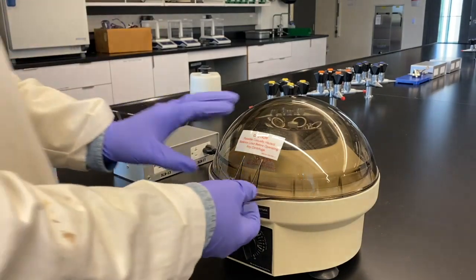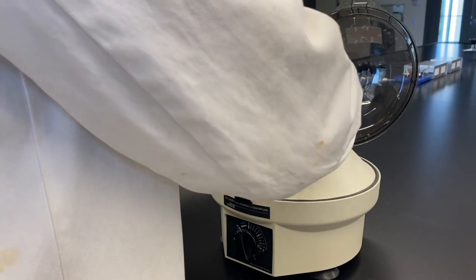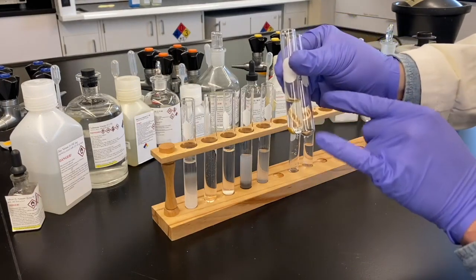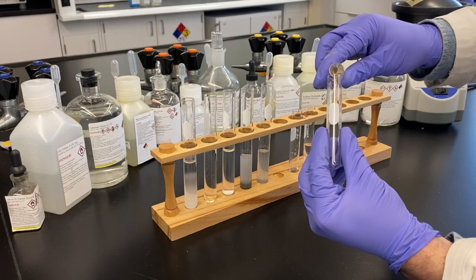And because it's such a strong color, it could just be overwhelming any other precipitate that would form in there as well. So we'll have to do some separating of this as well. Spin down the solid and pour off the supernate, just to make sure there's no other ions in there.